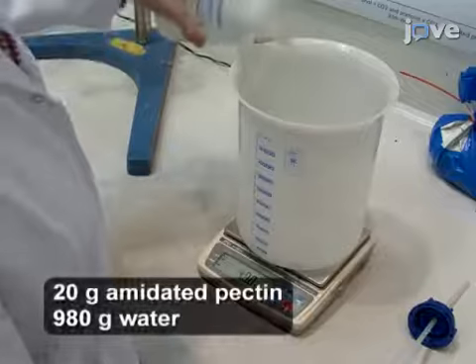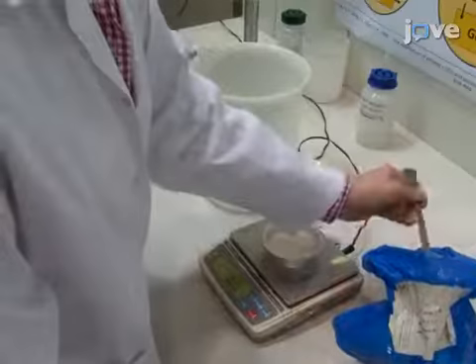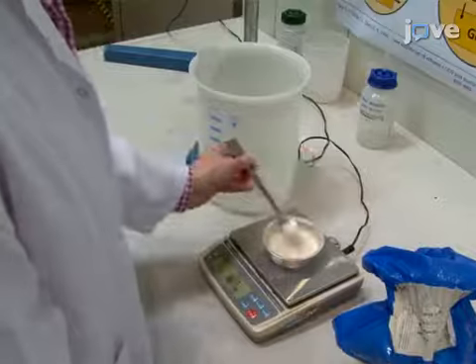This section demonstrates how amidated pectin and calcium carbonate dispersion is made in water. However, the procedure can be adapted to making many other solution mixtures.